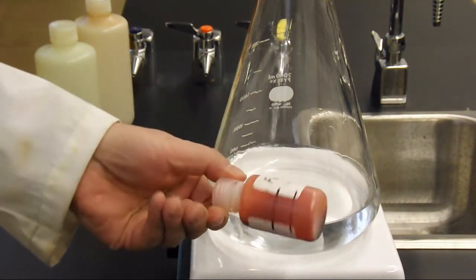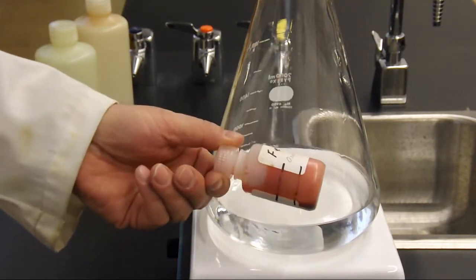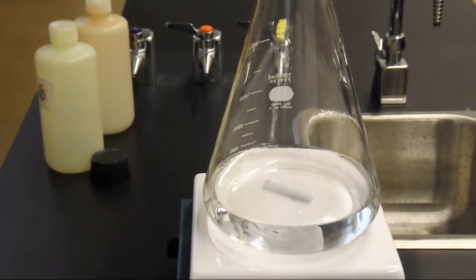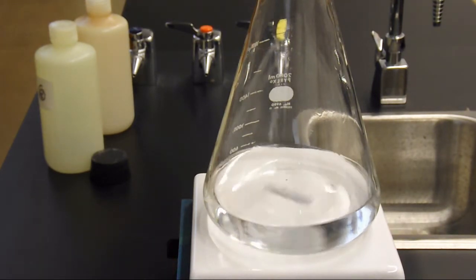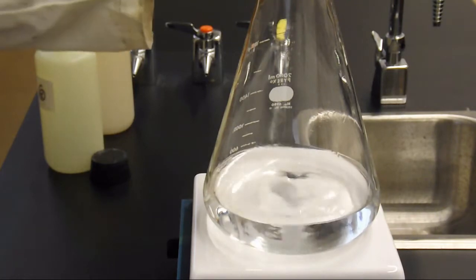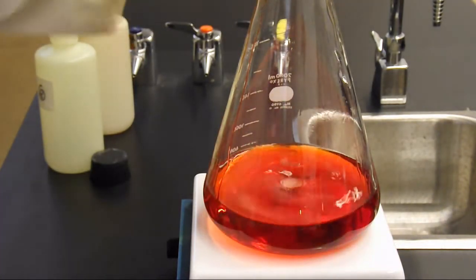Now, I don't know if you can see this, but this is a reddish, dark red liquid. First of all, I want to start this thing stirring so that we get good mixing going on here. Now adding a third red liquid to that — what am I going to get?